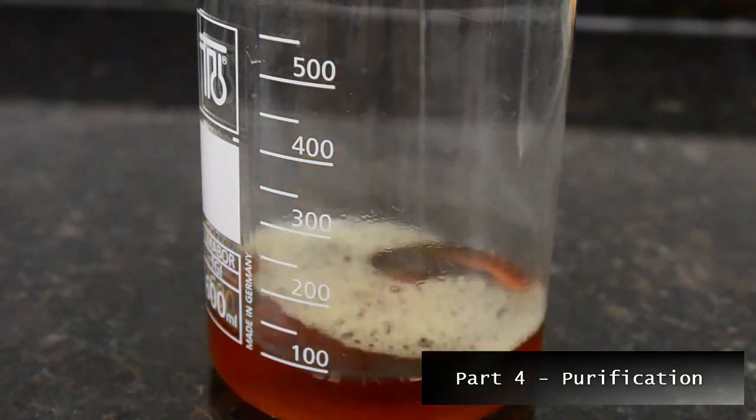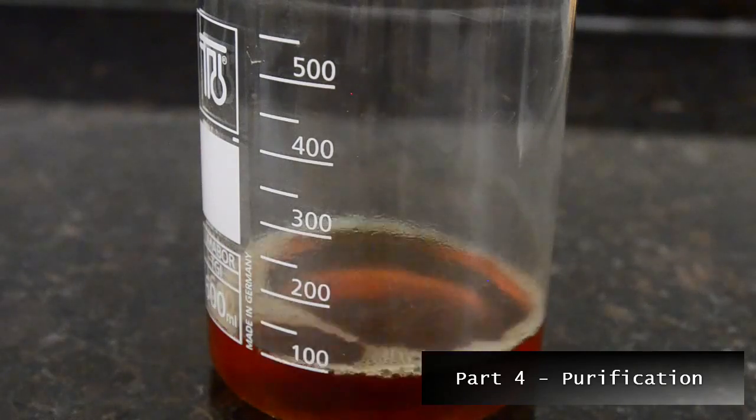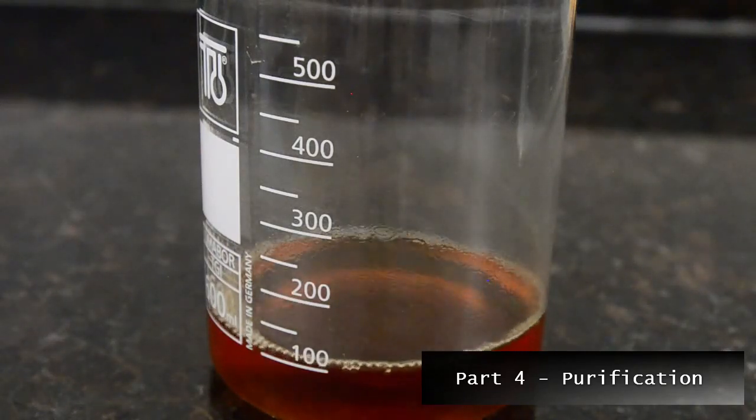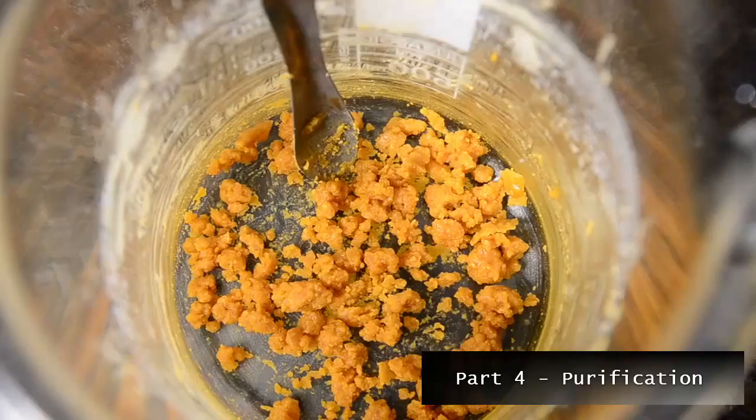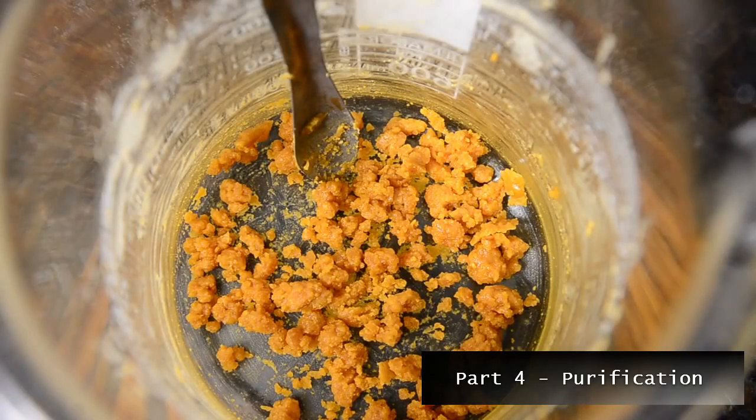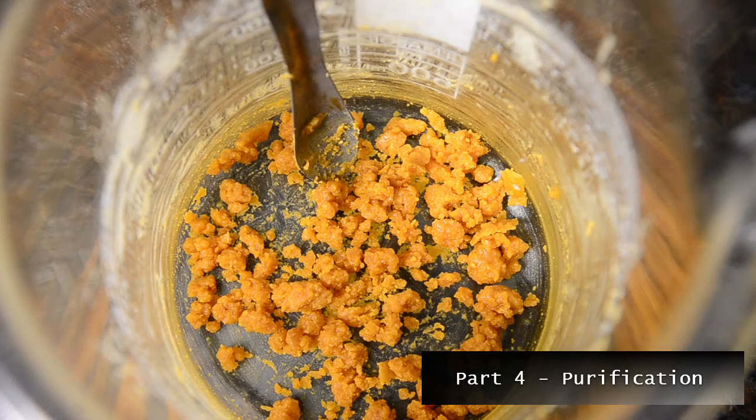Be careful not to allow the mixture to absorb moisture and be very careful with inflammable ether vapor. Use gentle heat when removing the last bit of ether from the crystals, but don't go too hard or the crystals will melt and potentially decompose.